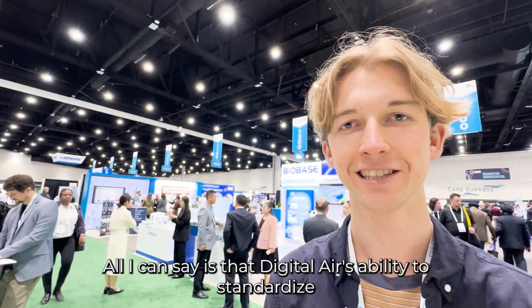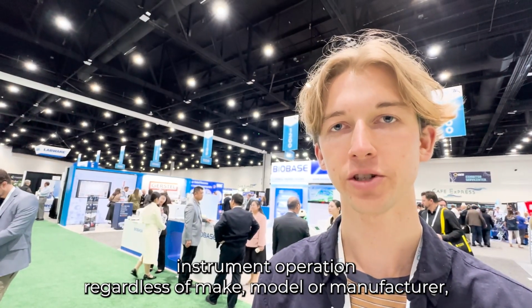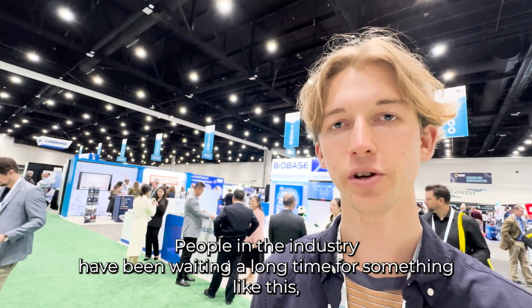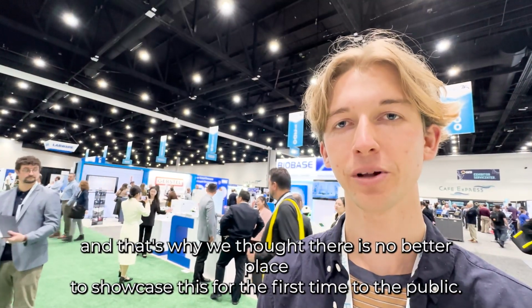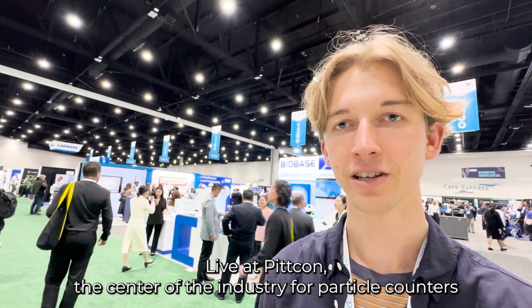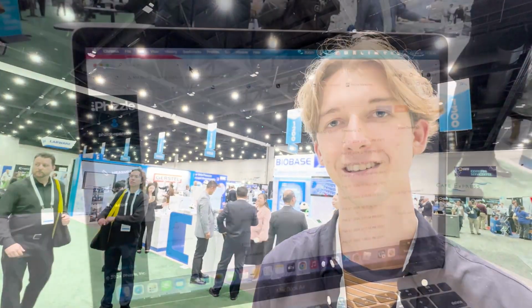All I can say is that Digital Air's ability to standardize instrument operation regardless of make, model, or manufacturer, and also sample remotely, makes it a solution unlike anything this market has ever seen. People in the industry have been waiting a long time for something like this, and that's why we thought there was no better place to showcase this for the first time to the public than live at Pittcon, the center of the industry for particle counters and balances. And with Digital Air, it has finally arrived.